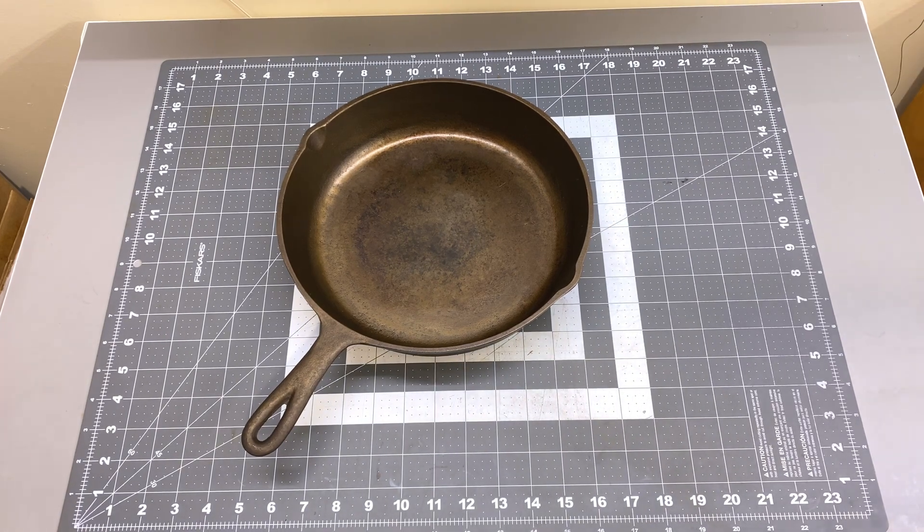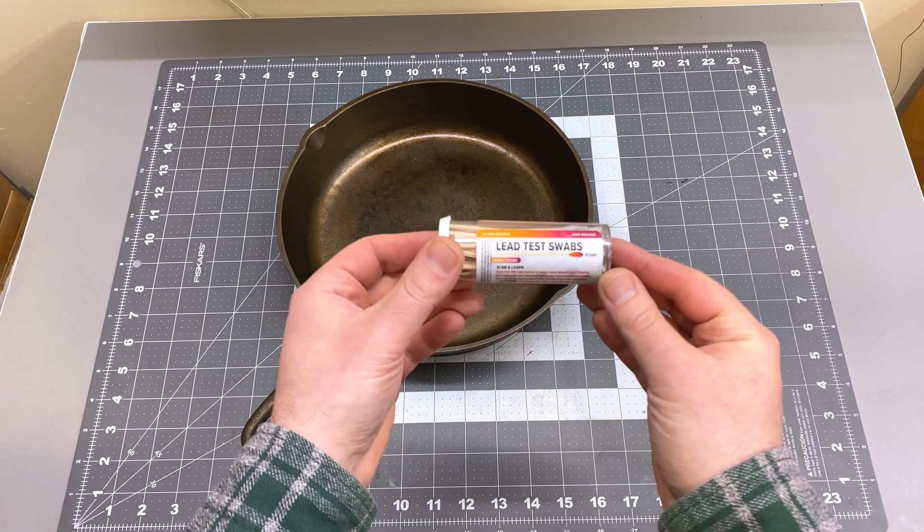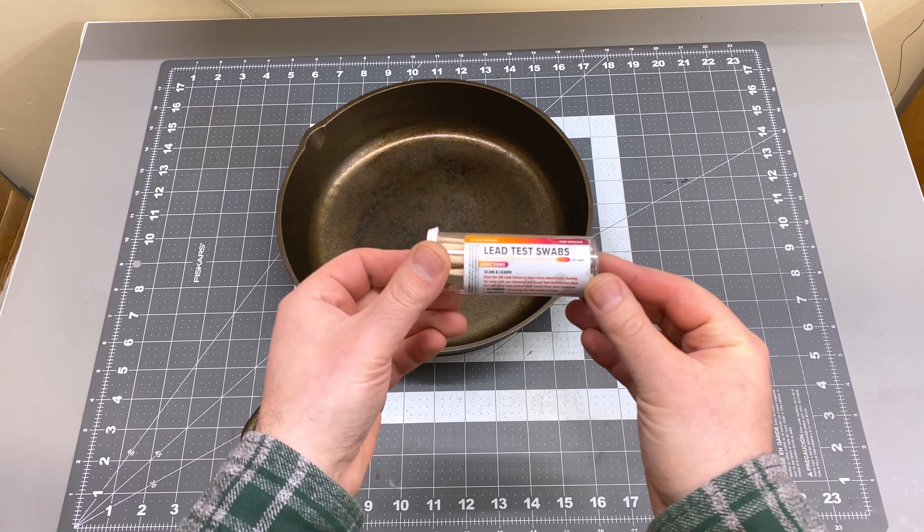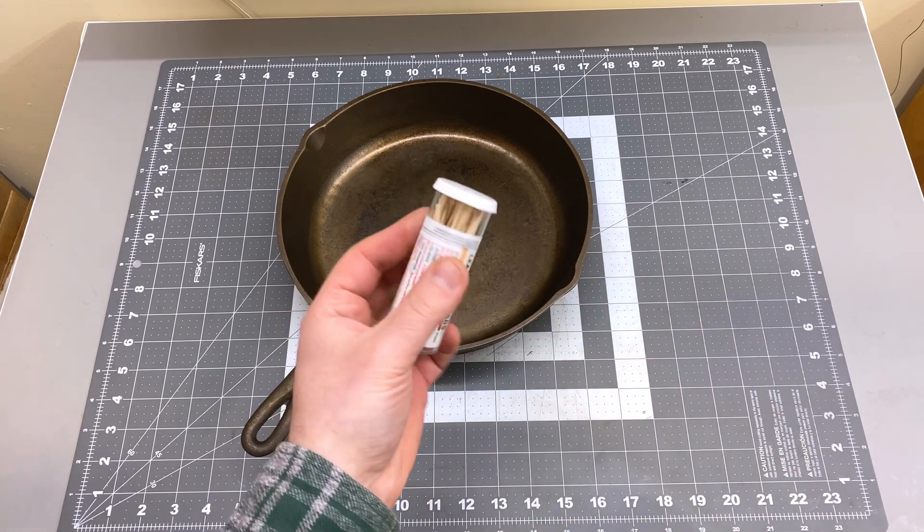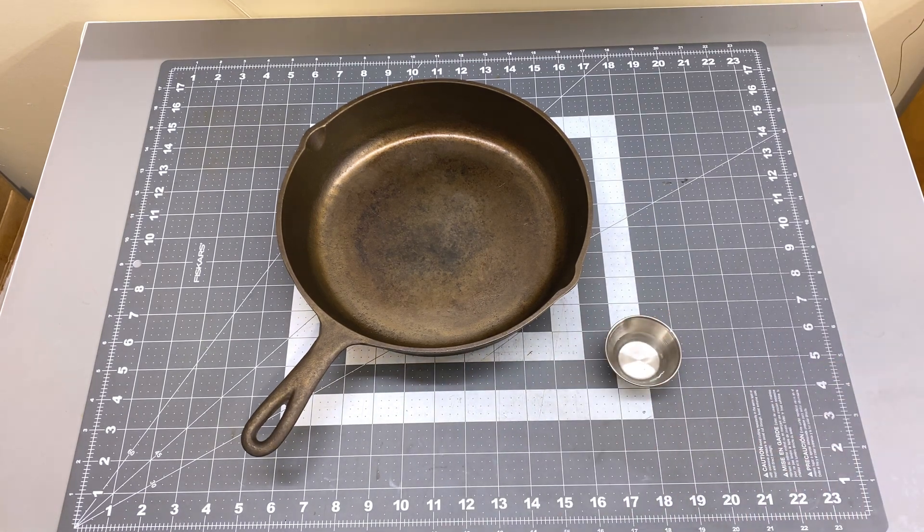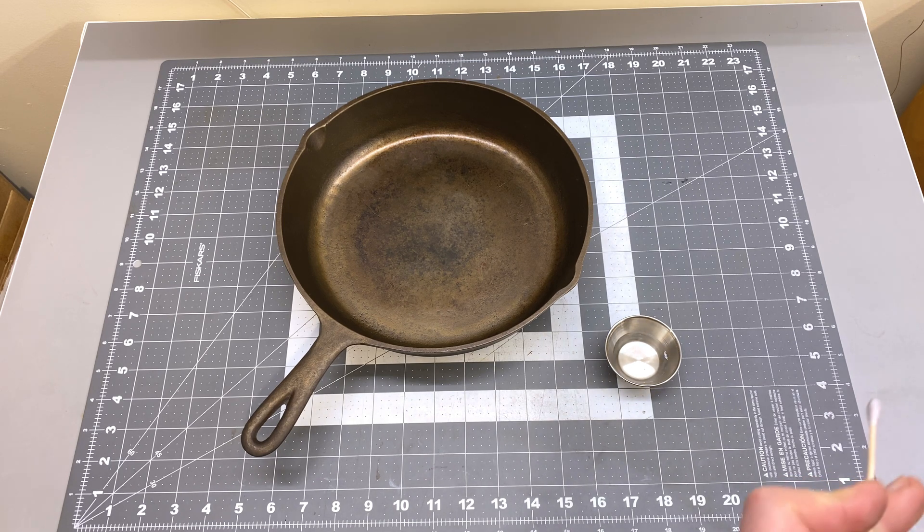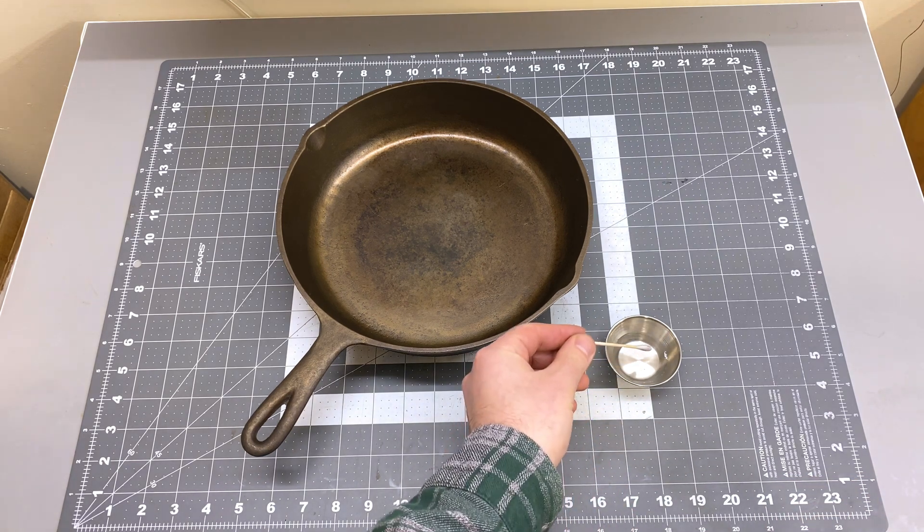I'm going to use these lead test swabs to test each of the pans and I just picked these up online. There are officially recognized testing kits made by 3M but you only get two in those and they're rather expensive, so we will see if these give us any results.